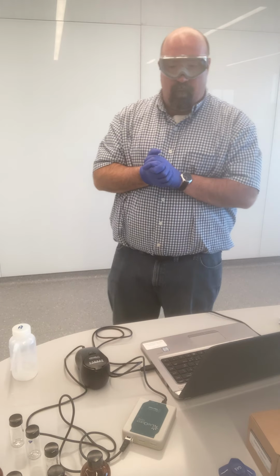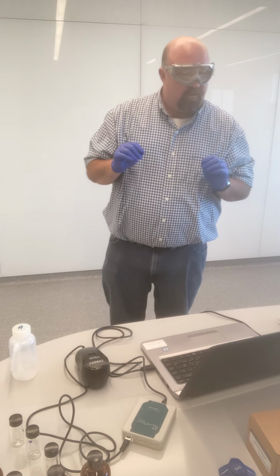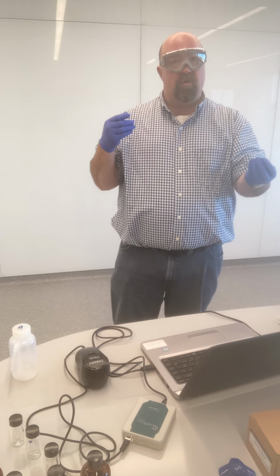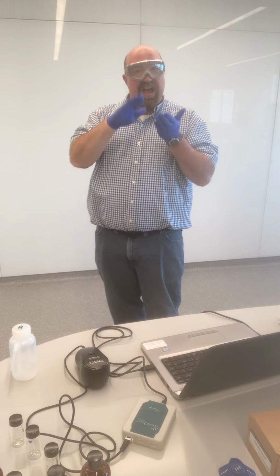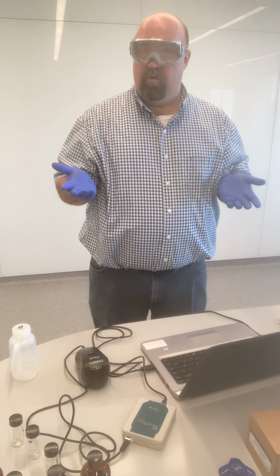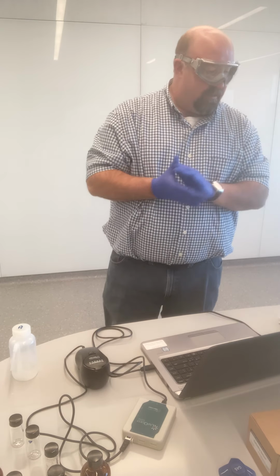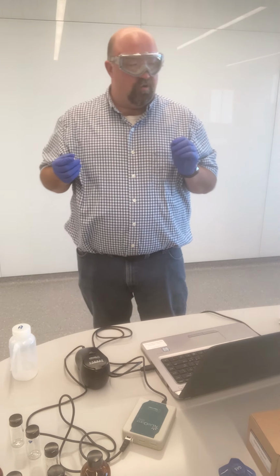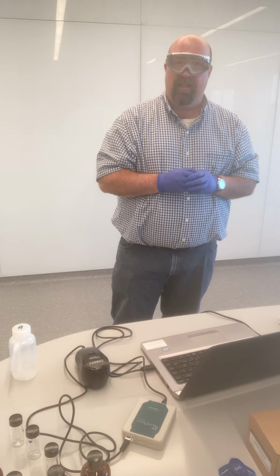As discussed in pre-lab, hopefully, if I remembered to, with calibrations of instruments like this, the measurements are only valid within our calibration zone. In other words, our calibration standards were 0 NTUs and 100 NTUs. That means that any measurements that we take are only valid within that range. Outside of that range, we don't know if the same relationship necessarily holds true, so we cannot simply trust those measurements. So what I need to do now that I have a measurement that is so far outside of my calibration range is dilute sample spot 4 down to a point where it is going to be within our calibration range.